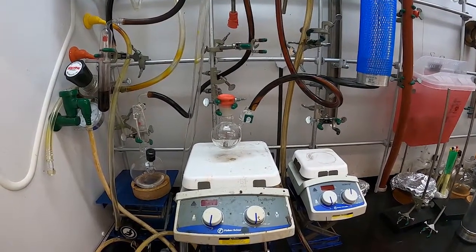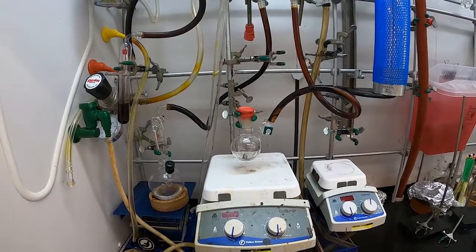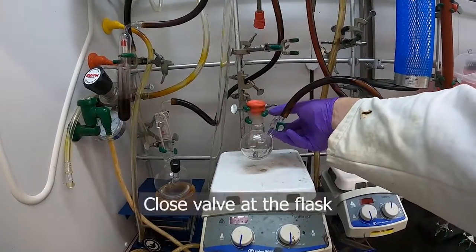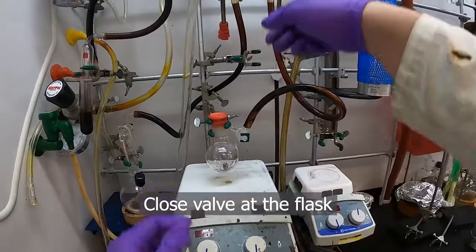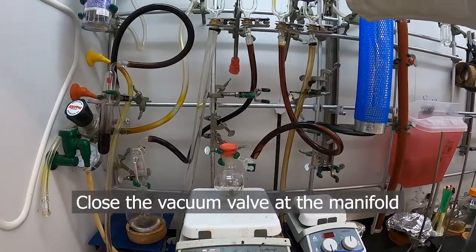So after we have evacuated the flask for five minutes, I'll close my key again, and turn off the vacuum up here.